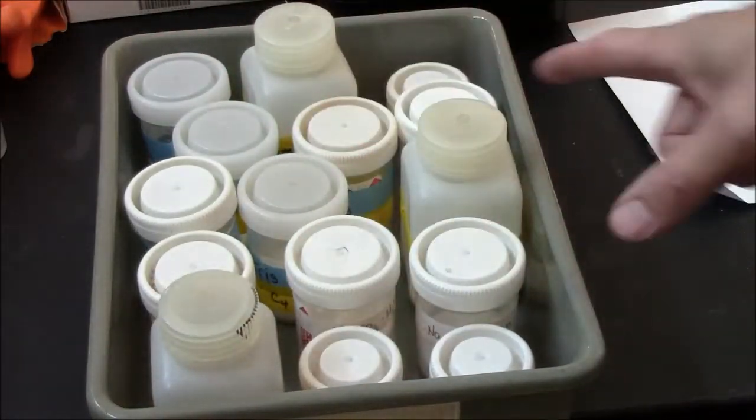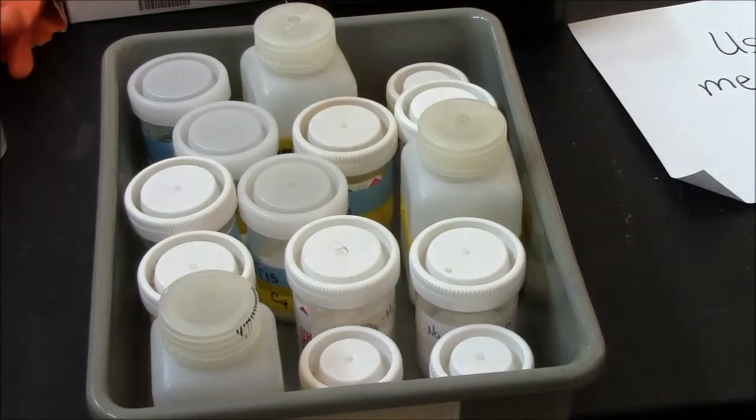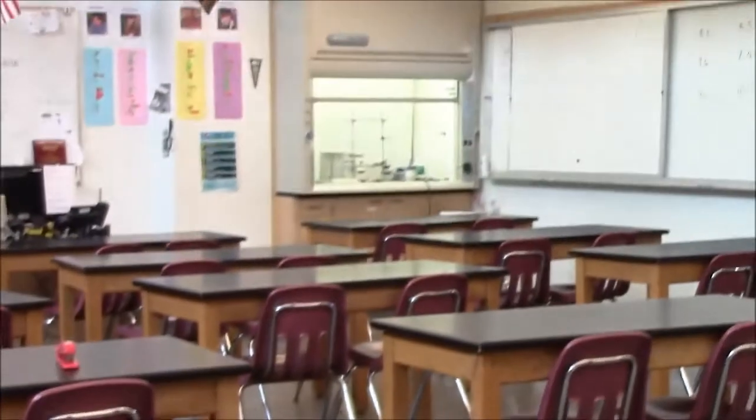The only buffer component that is not here is the glacial acetic acid. Glacial acetic acid is in the fume hood way over there.